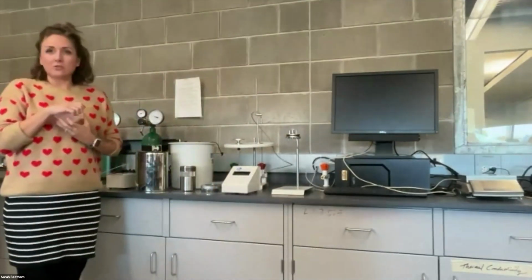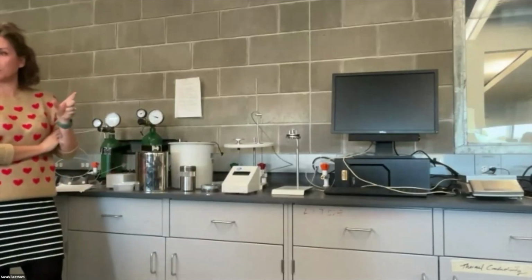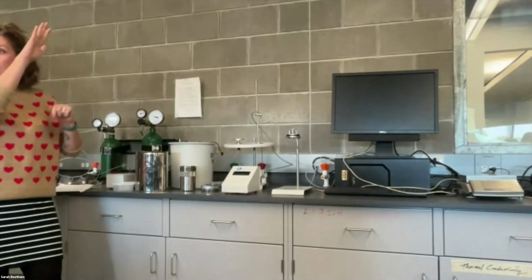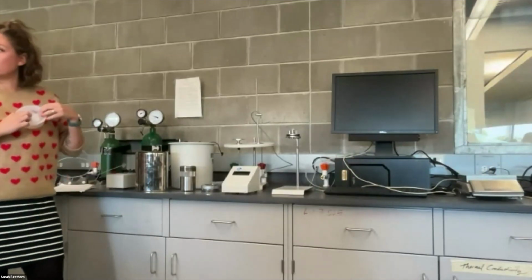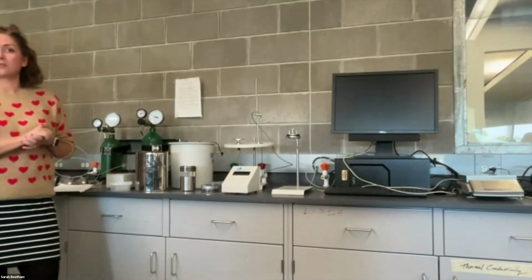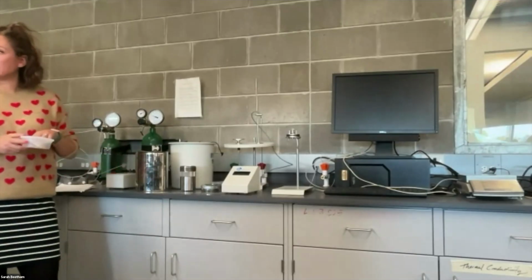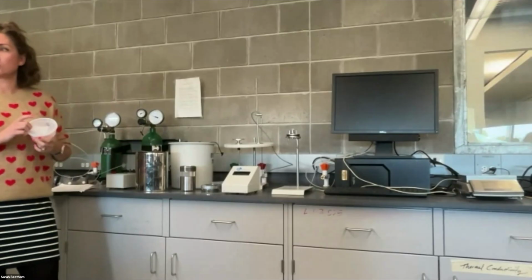On our lab sign up page, you may have noticed that there is a tab called food sample list. That food sample list is basically a column of numbers. Those are going to be correlated to these sample numbers. And then there will be masses in there that you're going to need to use for your lab calculations. So the mass of all the things in here have already been calculated and tabulated in there for you. That's why I want to make sure that you note down which number that you have.